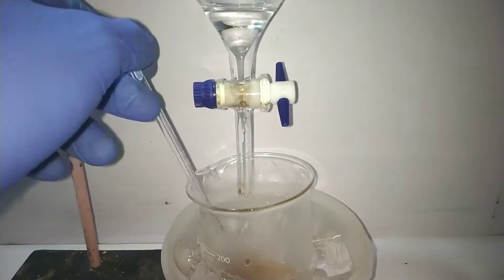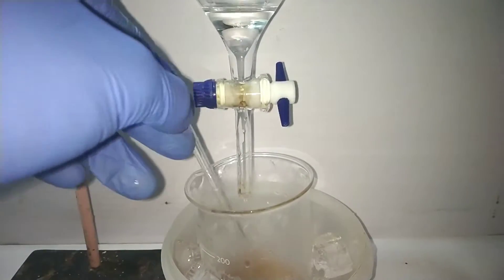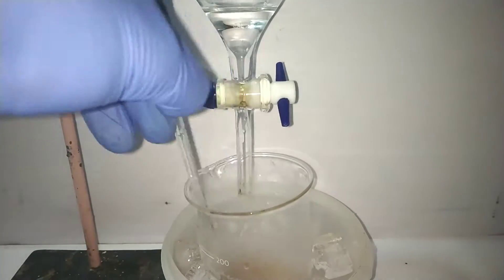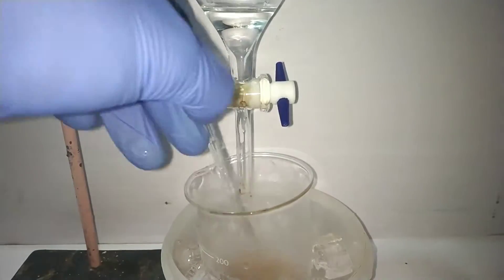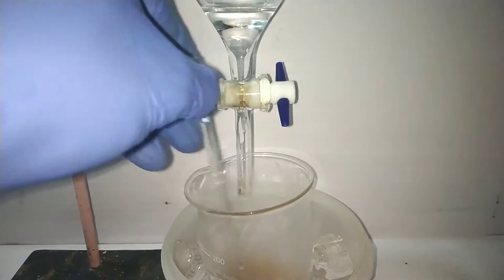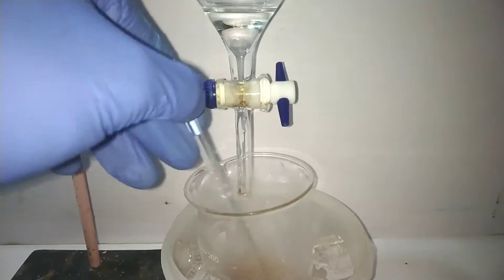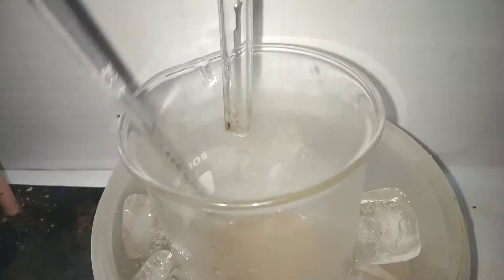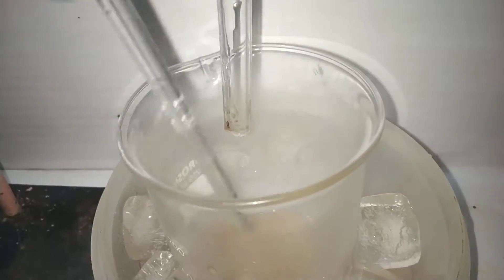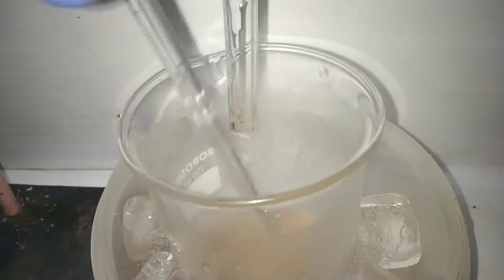The mixture was constantly stirred with a glass stir rod. The temperature was monitored and kept below 10 degrees Celsius. If we raise the temperature, there will be chances of formation of other side products.